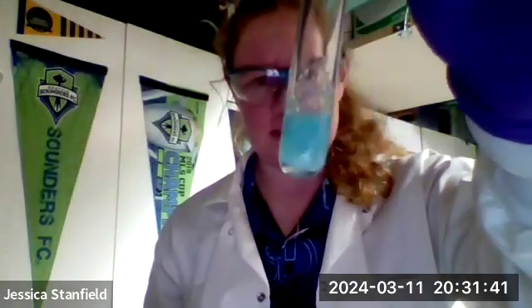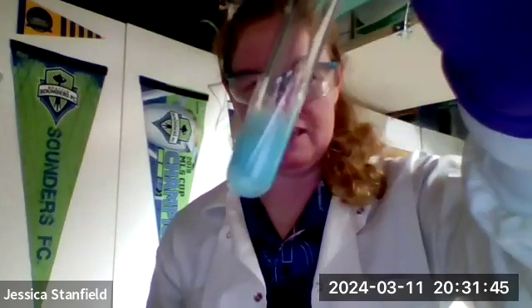Yeah, see, as I'm putting that in, this one, instead of being powdery, is kind of like this gelatinous precipitate. But you can see as I shake it, there's this gunk that's sticking on the sides of the test tube. Okay, so there's another evidence for a chemical reaction. All right, and then one more. What I'm going to do now is put some of that hydrochloric acid into a test tube.